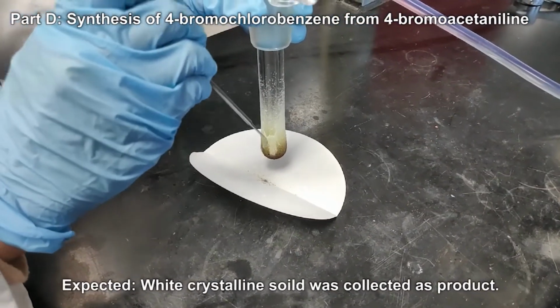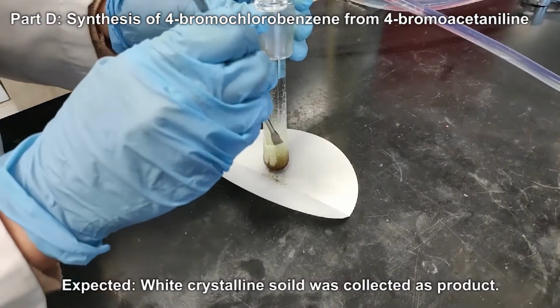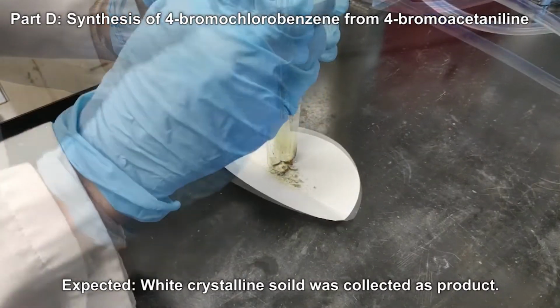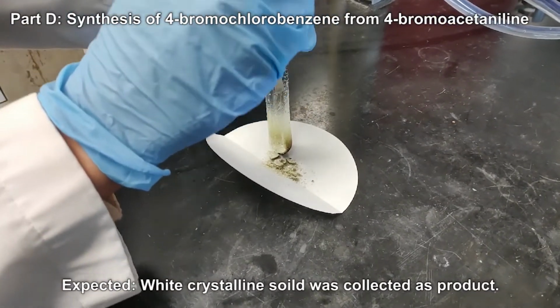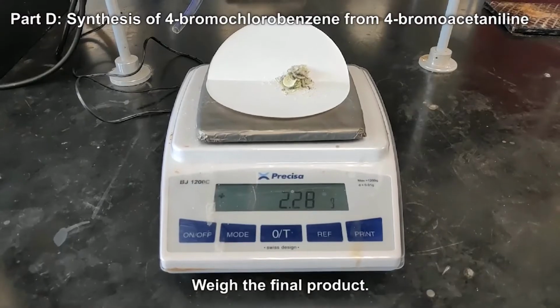It is expected that white crystalline solid was collected as the product. Weigh the final product.